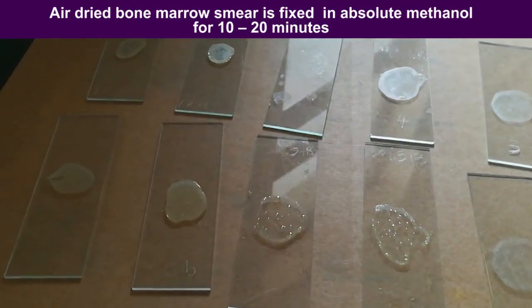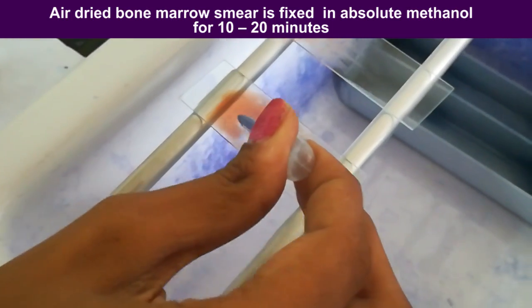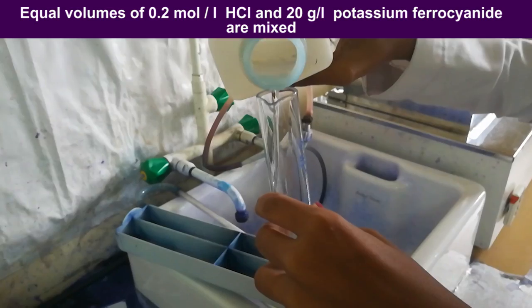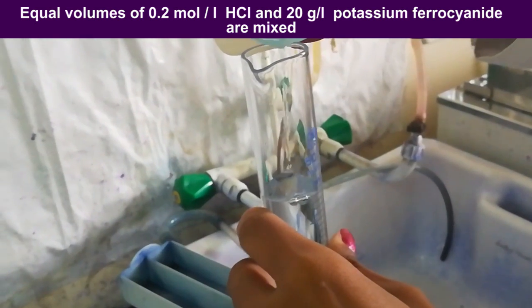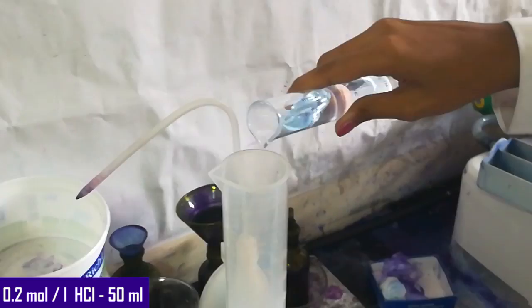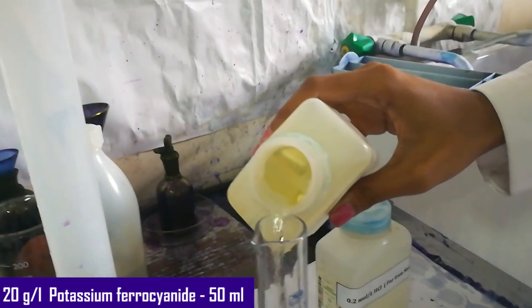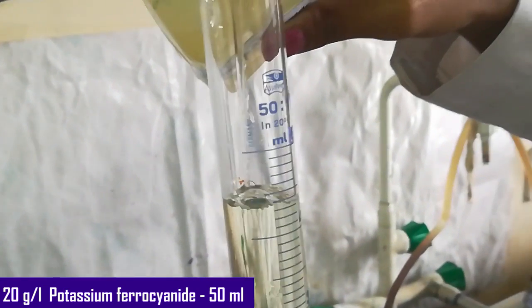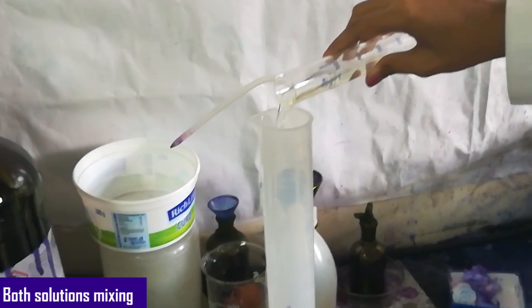The air-dried bone marrow smear is fixed in absolute methanol for 10 to 20 minutes. Then equal volumes of 0.2 mol/L hydrochloric acid and 20 grams per liter potassium ferrocyanide are mixed in a staining jar. Because this solution is unstable, it should be prepared immediately before use.